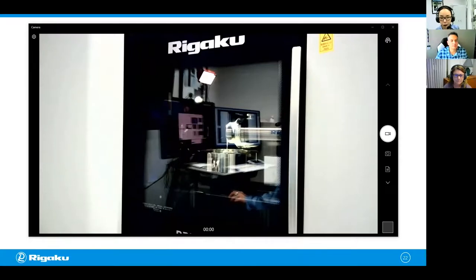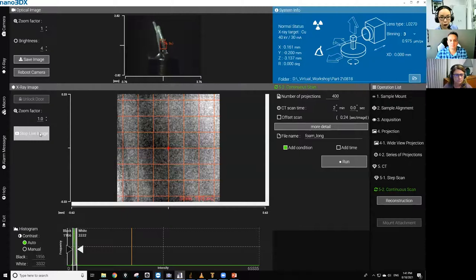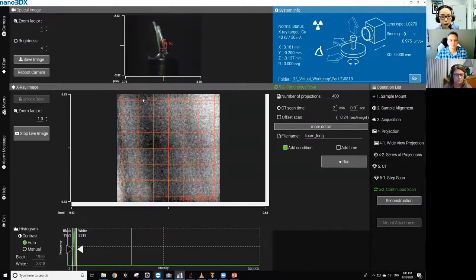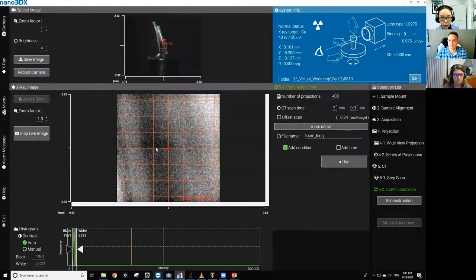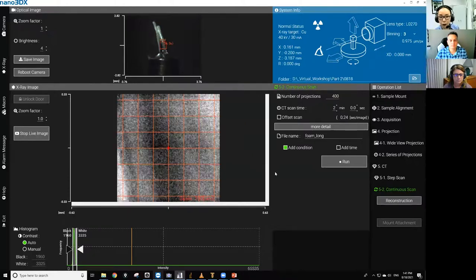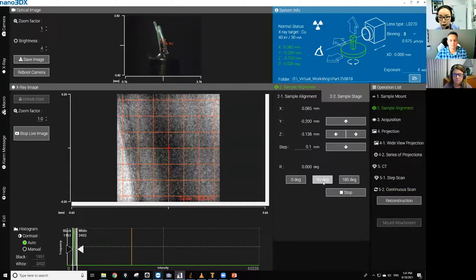Okay. Now let me switch this. Do you see a better view at the top now? Yes. So let me open the shutter and let's get the X-ray view as well, which probably doesn't show much in this case. You see a little bit darker part in the middle, and that's most likely coming from UV resin. So I'm going to center the sample using that, and let's do 90 degrees.